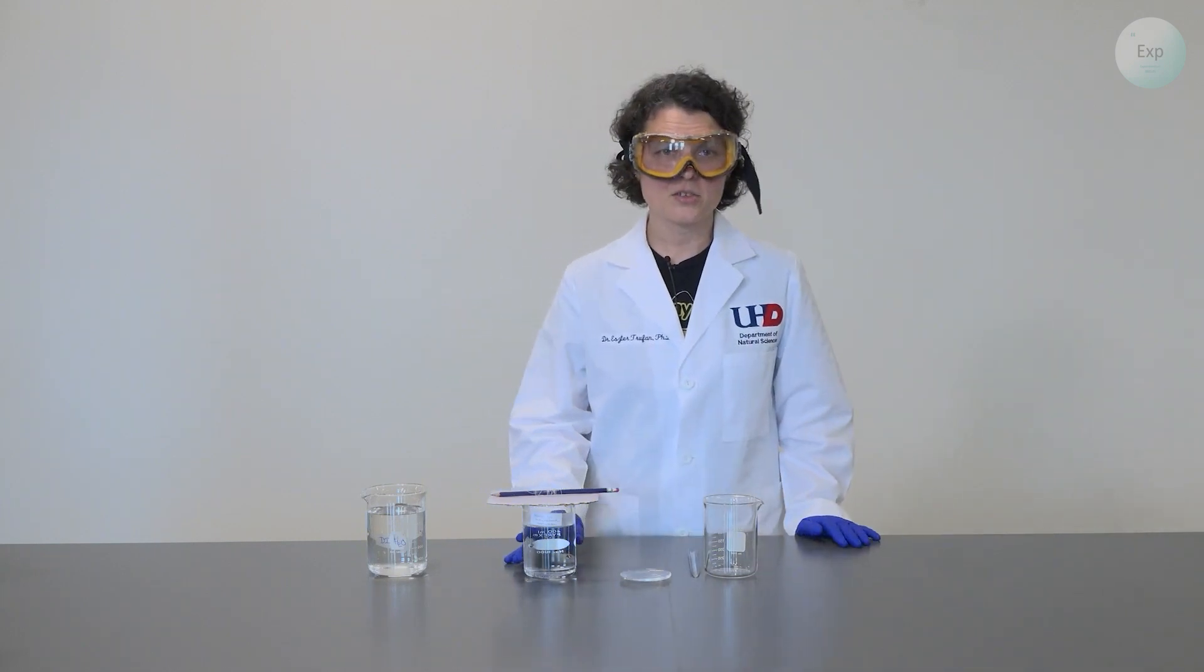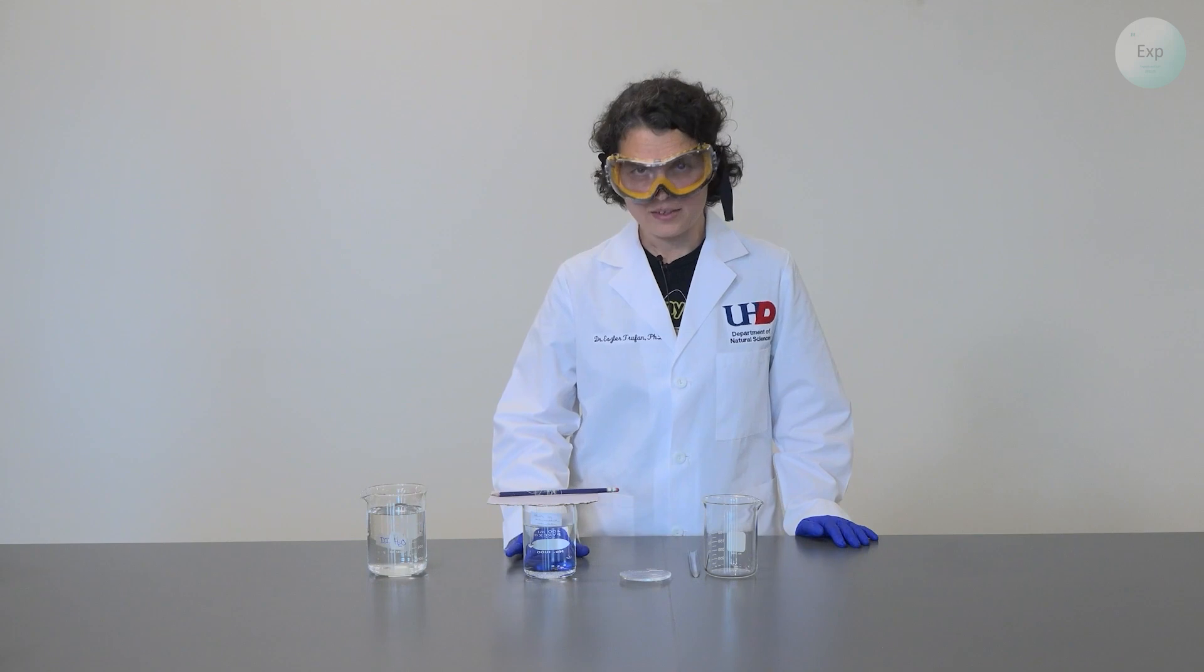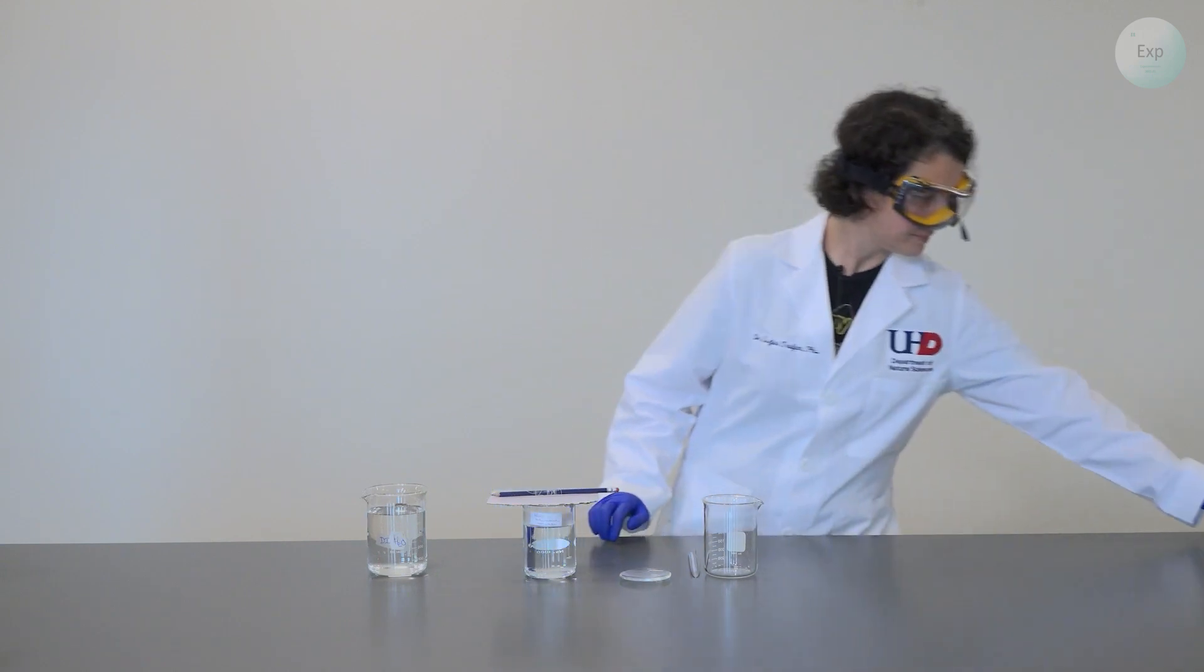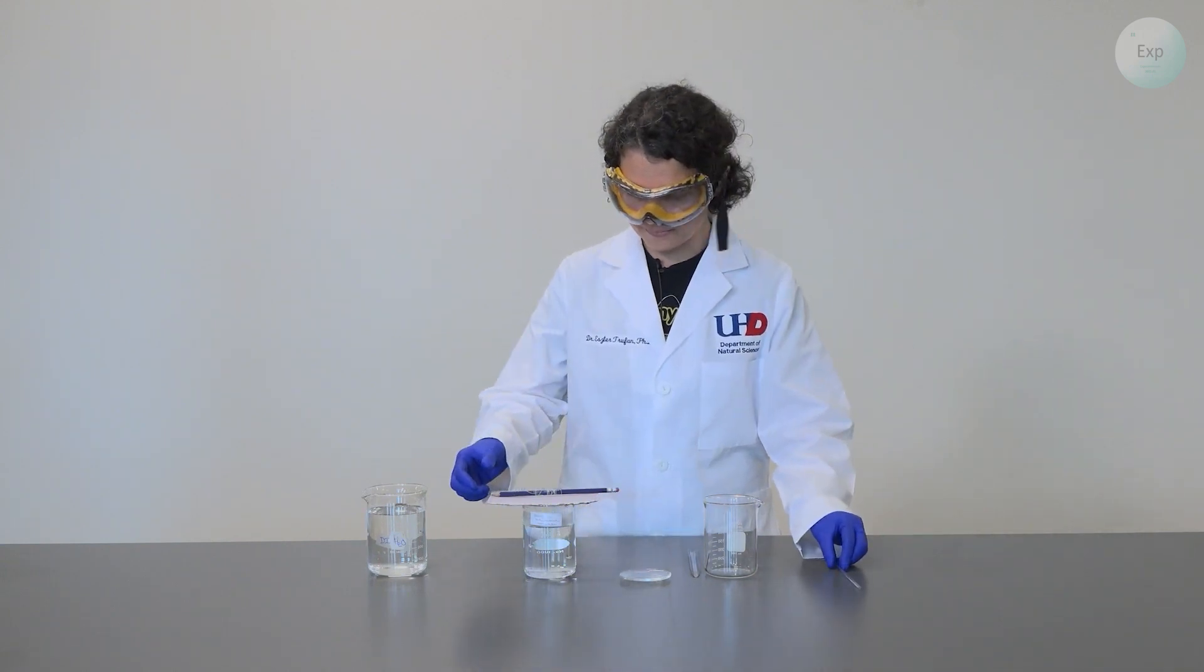To decant the solution from the top of the small crystals, we're going to also need a stirring rod, and that one will be used to complete a decanting process. So I have that here.